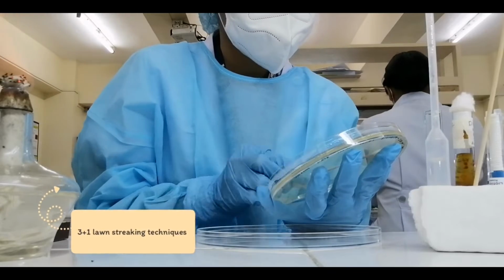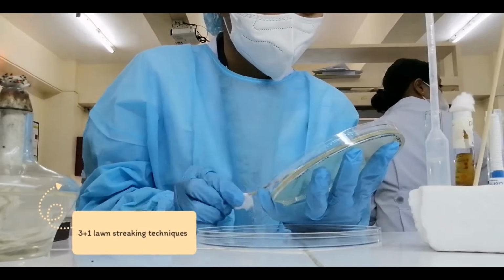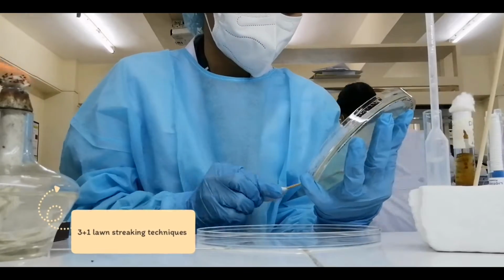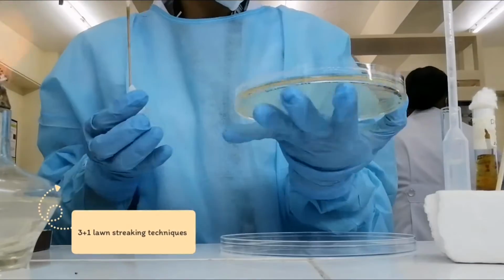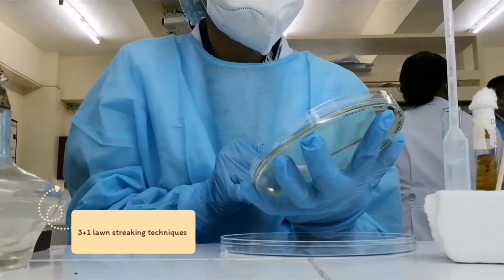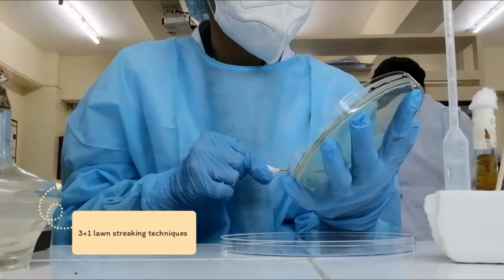Lawn cultures are prepared by evenly spreading a high amount of bacteria onto an agar plate using a sterile cotton swab soaked in the bacterial culture or suspension. After the first swab inoculation with organism, the second swab inoculation is rotated 60 degrees or 1/3 to the first inoculation. Use the same swab and don't re-inoculate it. Remember to carefully cover all the surface area without leaving gaps or spaces.